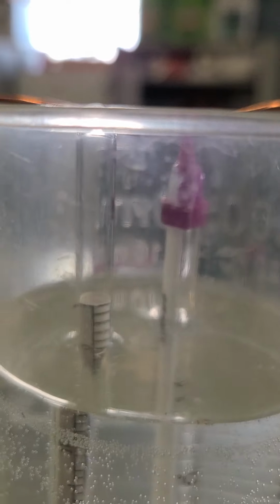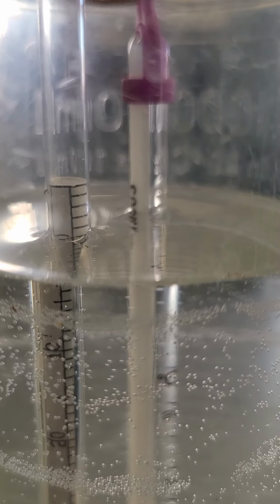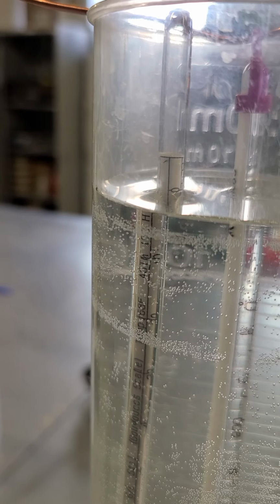And we can see our blank here. We're looking at our blank. Our blank has pretty much stayed the same. We might actually have, let me see here. Yeah, our blank, I'm going to move it around just a little bit. Our blank is sitting a little bit closer to 0 too, and a lot of that has to do with, we can't really see it, but a lot of that has to do with the fact that the temperature in the room has changed.